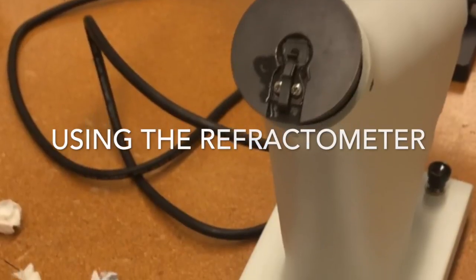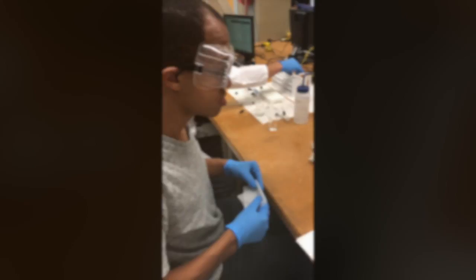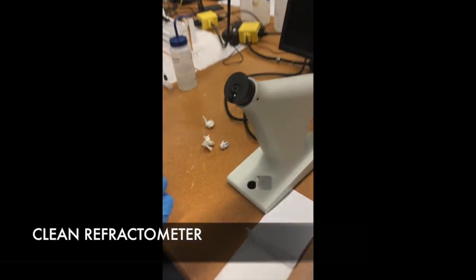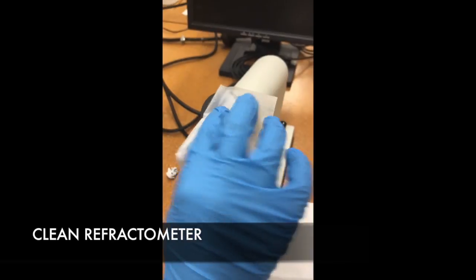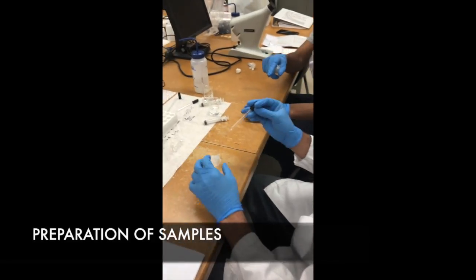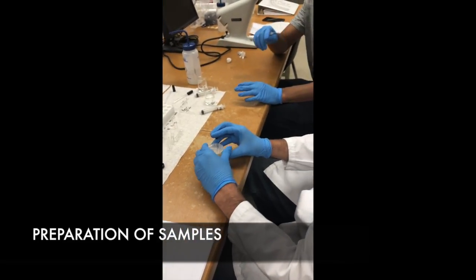Now we have our refractometer, which we'll use to measure the refractive index of the samples to determine the ethanol concentration of a sample. Before using it, it is important to clean the refractometer using a Kimwipe. Here we have the preparation of the samples before they are put into the refractometer to be analyzed.